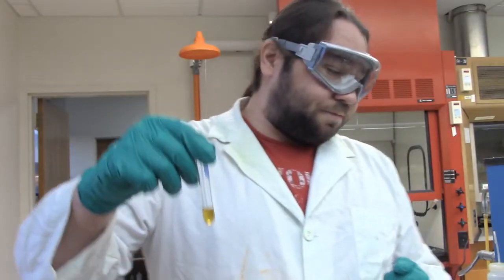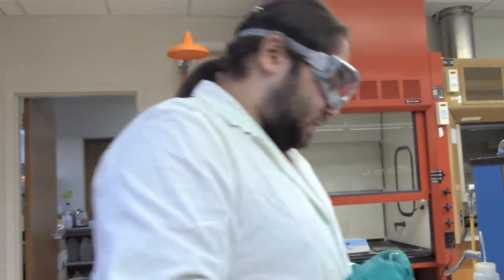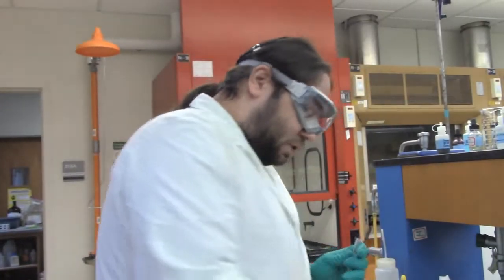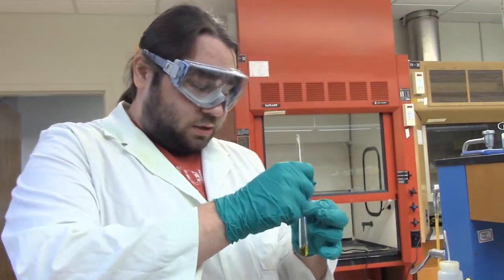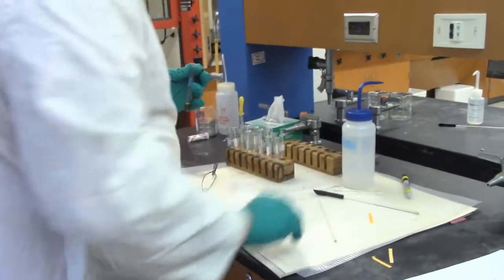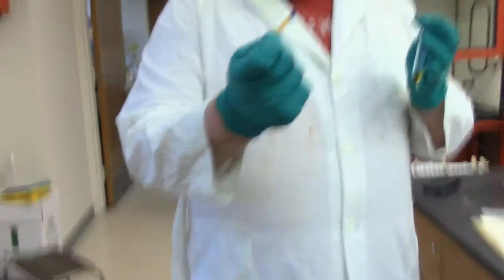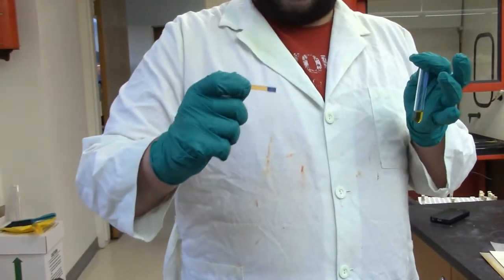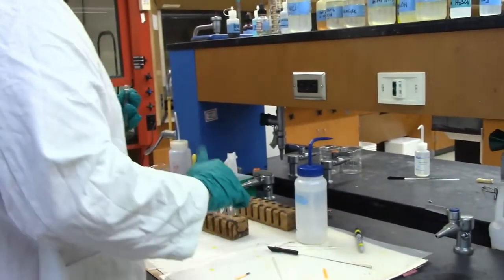So starting with this, just going by the order that's on the paper, we're testing for tin in our supernatant. So we're going to add some 6 molar HCl to adjust the pH. But you guys should know by now that if we're adjusting the pH, I like to know where we're starting at. So give it a little drop. And because we did make this supernatant by putting a whole bunch of KOH in there, we should not be surprised at all to see that that is a deep dark blue color. So we are basic.